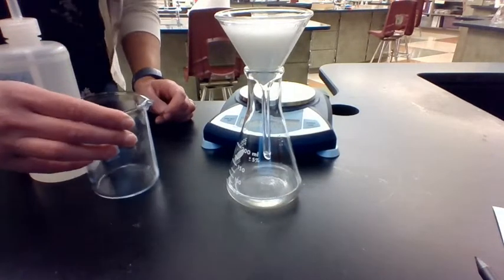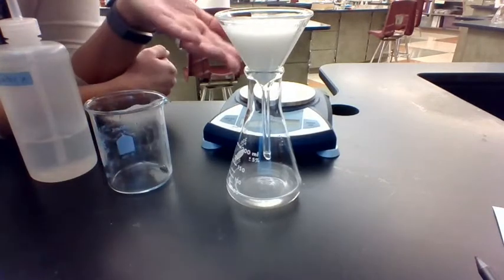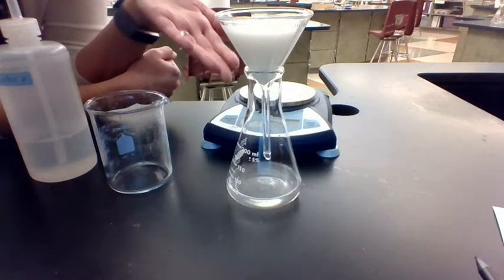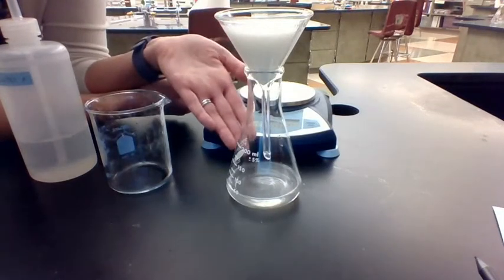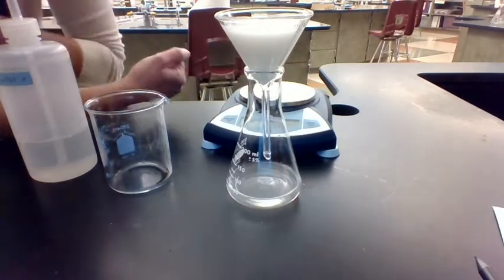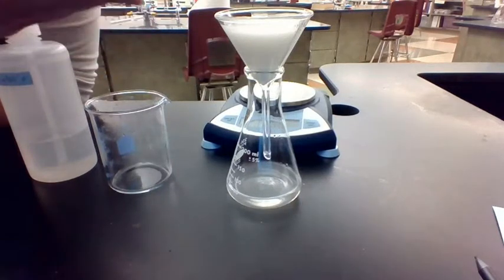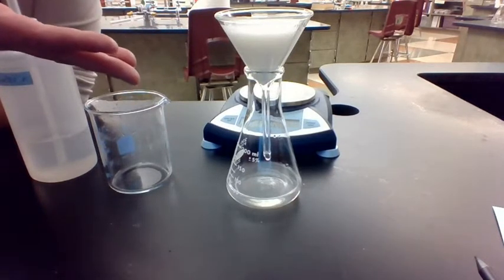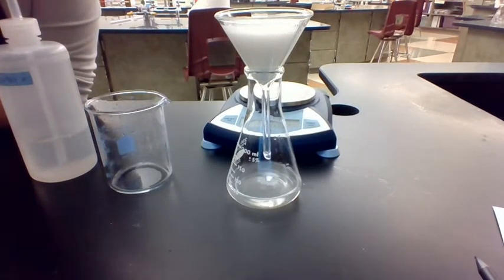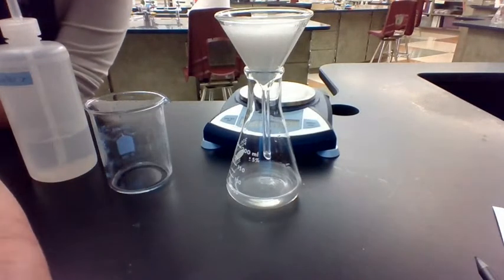And then what we're going to do next is we will have filtered this, which will have successfully separated the solid from the rest of the solution. So we'll have gotten a lot of the water out and also any other excess aqueous ions that are floating around in the solution. But my solid's still going to be pretty wet. So what we're going to do next is dry it in a drying oven to get rid of the extra water to make sure we can then collect just our pure solid precipitate. And that's what we're going to want to weigh. So I'm going to pause the video again, let this finish filtering, then we'll stick it in the drying oven.